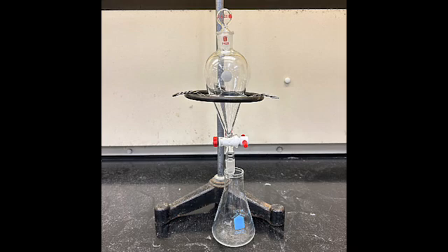Now let's demonstrate how to secure the separatory funnel correctly on the ring stand. Also make sure the stopcock is properly closed before adding any liquids.